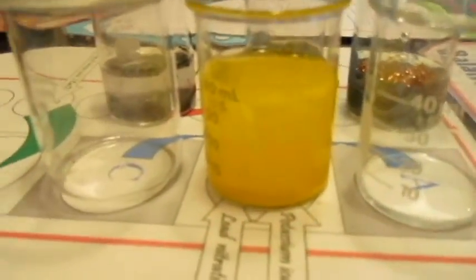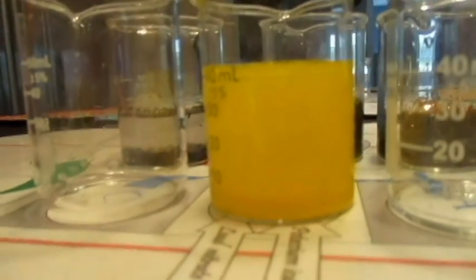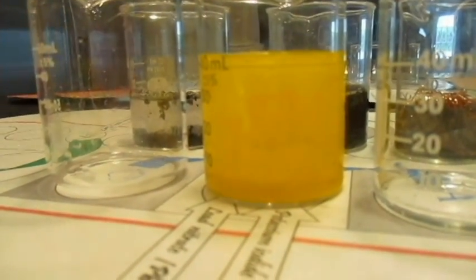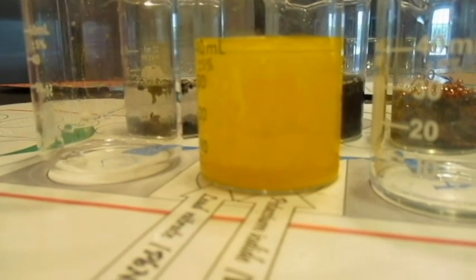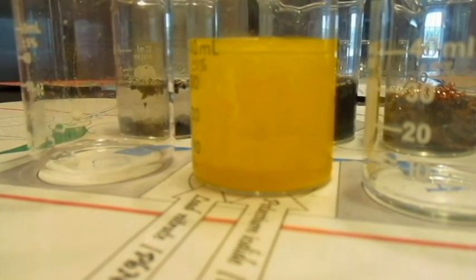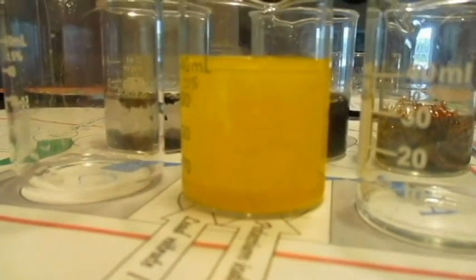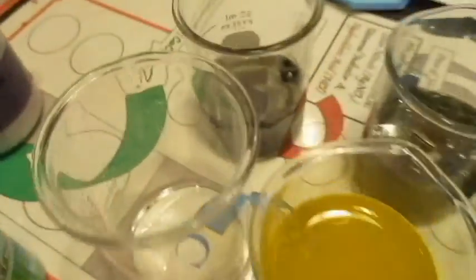Let me just mention a couple of others. It looks like orange juice. Look at it from the side. Yum. You can kind of see some stuff on the sides. Yeah, so we're going to come back and look at it in a few more minutes, and see what's happening here. Also, I think that reaction's still going.